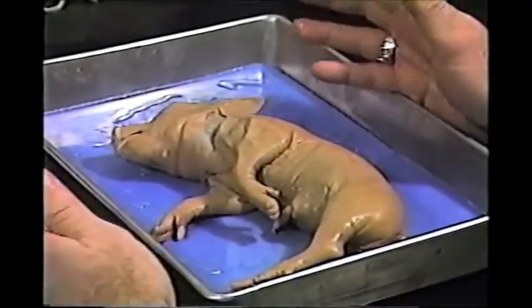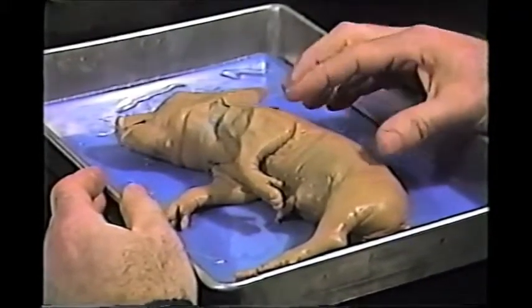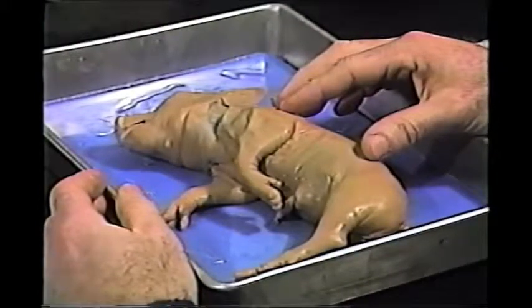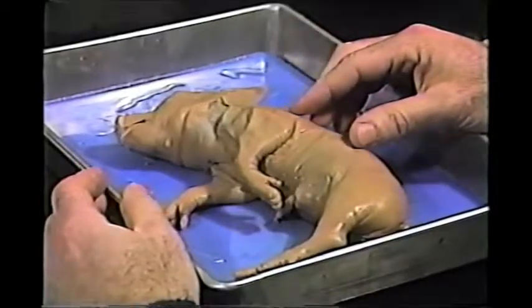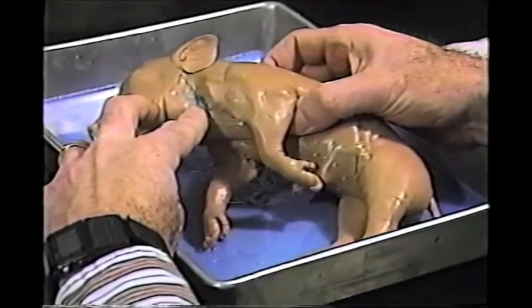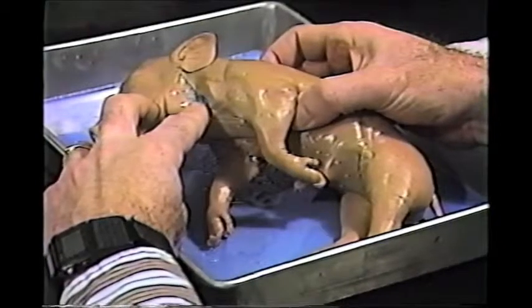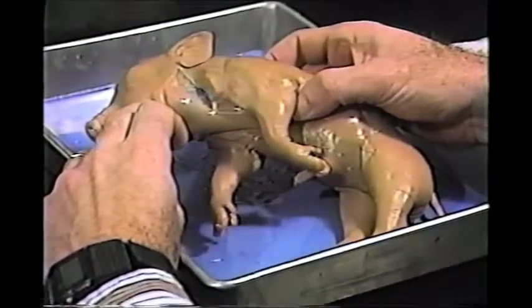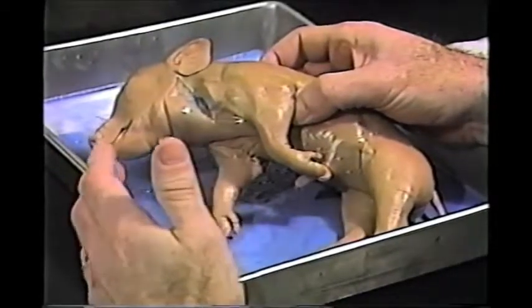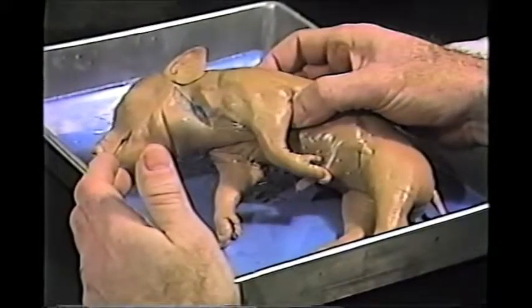Now, these fetal pigs were not killed just for the dissection that we're going to do today. These pigs were, when the sow, their mother, was slaughtered at the meat market, and the fetal pigs would have been discarded anyhow. So various supply houses purchased them, and you notice there's a gash in the neck. This is where the blood was drained out of them, and blue latex dye was injected into the veins, and red latex dye into the arteries. So when we do dissect the pig, we're going to see red and blue blood vessels, and ordinarily, of course, they would all be red with blood running through them.